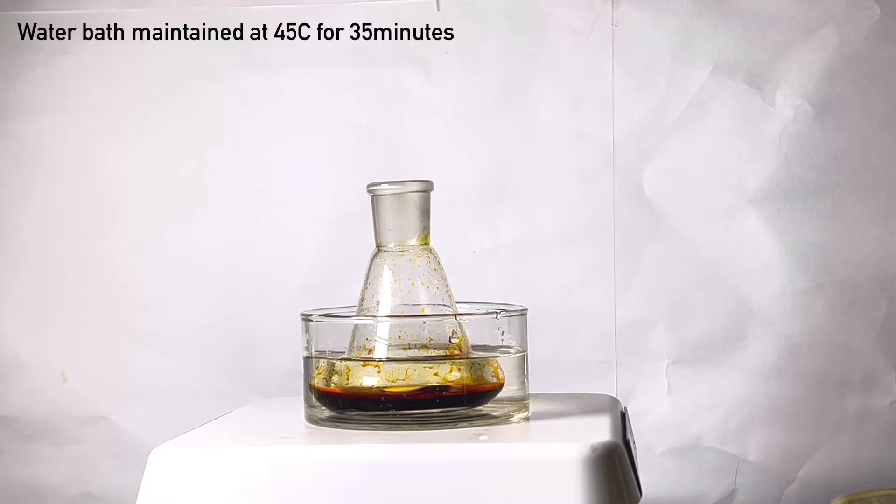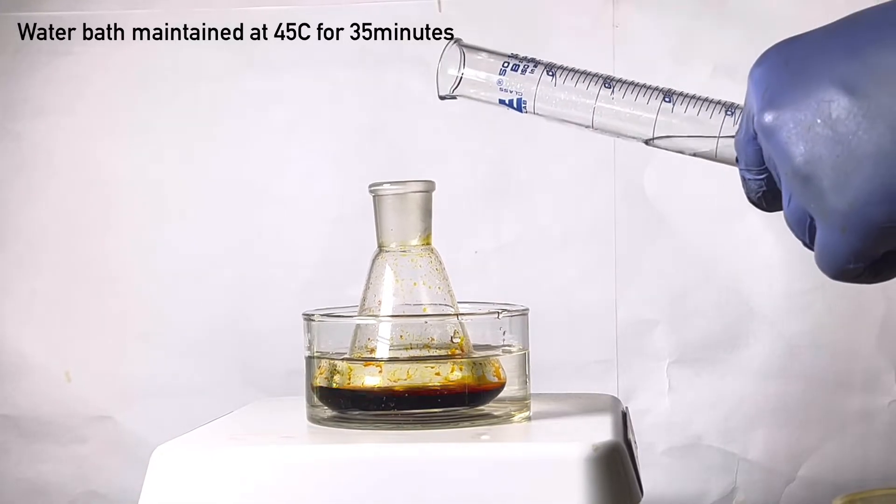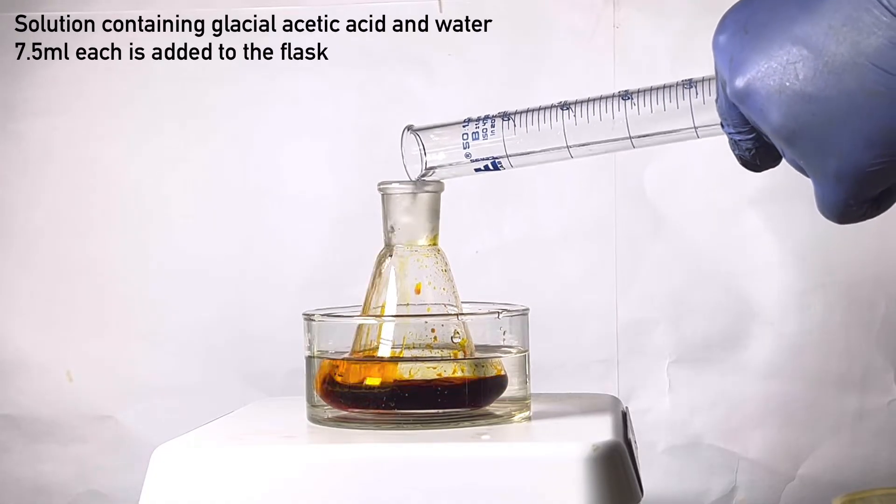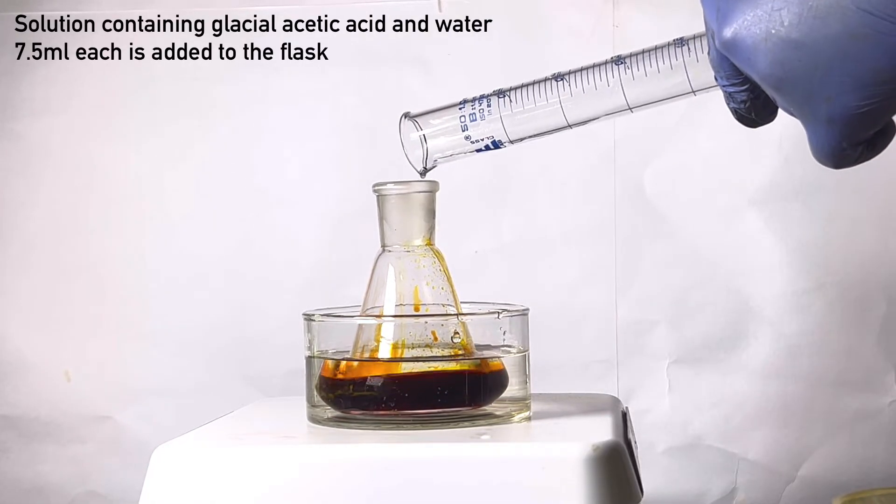After 35 minutes, add a solution of equal volumes of glacial acetic acid and water, 7.5 milliliters each. Now, allow the mixture to stand for some time in the refrigerator.